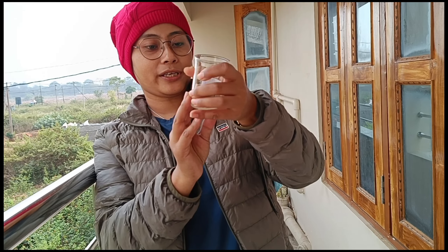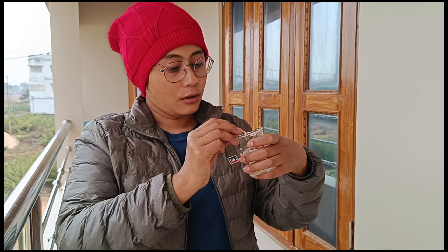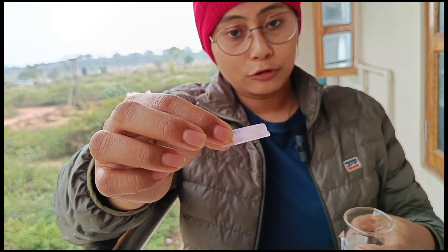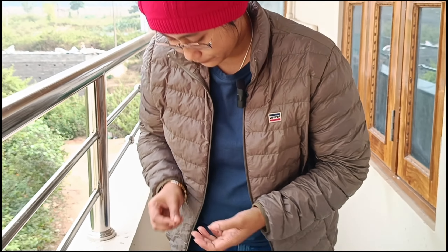Here is the plant extract that doesn't have a phenolic compound. Let's see how the color turns out. This is the color you get when you don't find phenolic compounds, or very less phenolic compounds. This is how you try to detect their absence. On the other hand, I'm going to show you a plant with a good phenolic compound content.